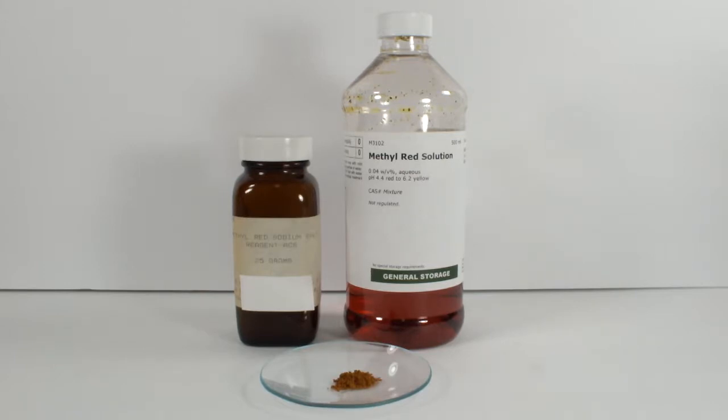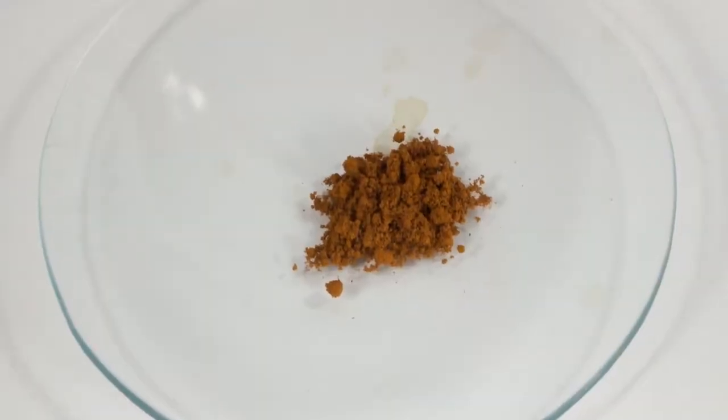Instead of the free acid structure shown on the previous page, I have the sodium salt in stock. As you can see, the dry powder is an orangey-brown color.